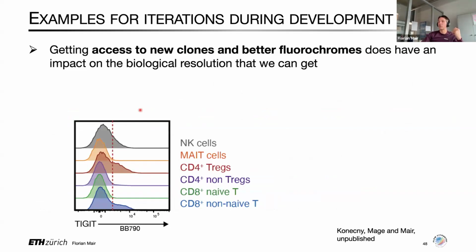And I want to show you here an example where TIGIT, if you ever stain for TIGIT, you know it's coming up on some effector cells, mostly on the Tregs. And it's a reasonably hard marker to stain. And here you can see the shoulder pulling out. And you could actually say, well, that's okay, I can work with that. But maybe, you know, it could be a little better.